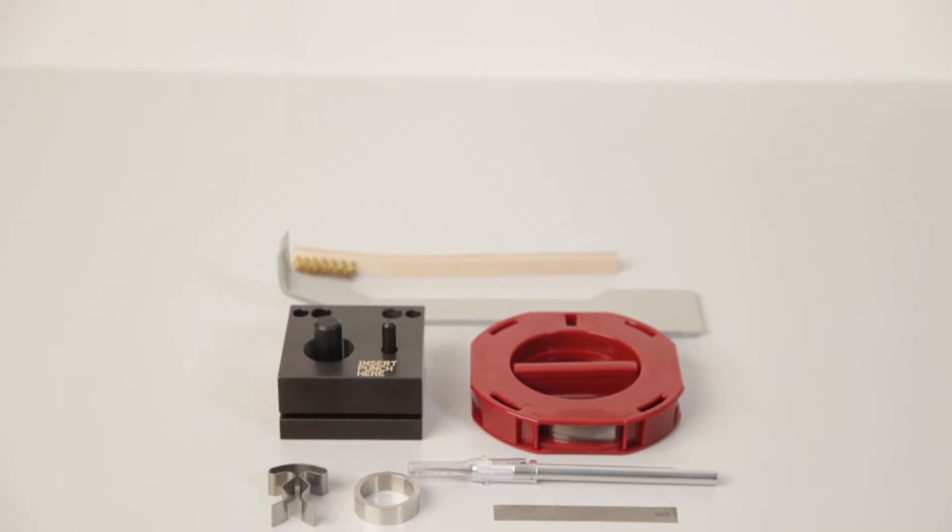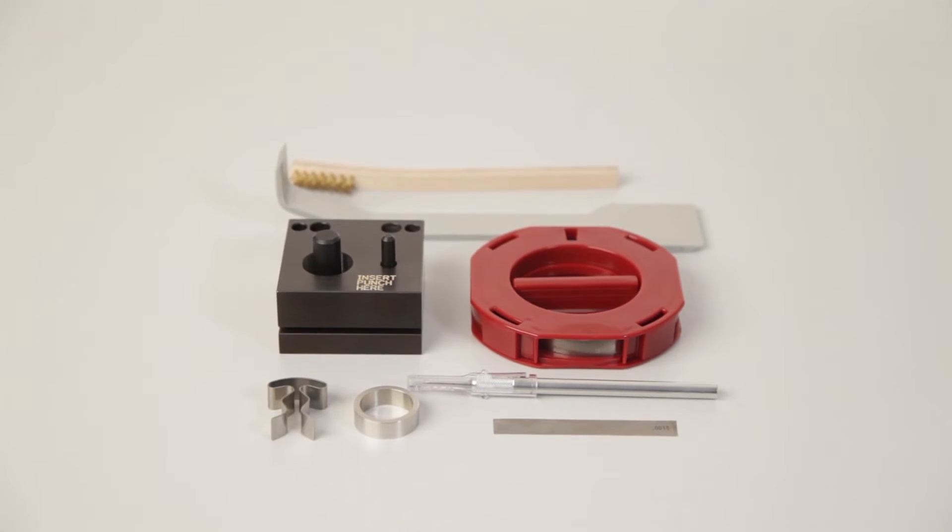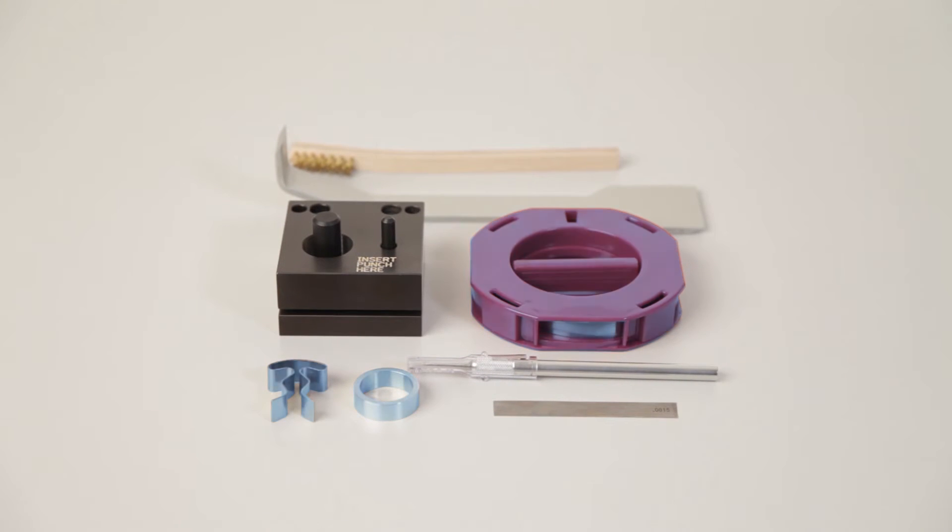The melt preparation kit comes with items that will aid in preparation and cleaning of a polymer melt sample. In order to load polymer pellets, the metal clip, ring, and roll of thin stainless steel shim material will be used.